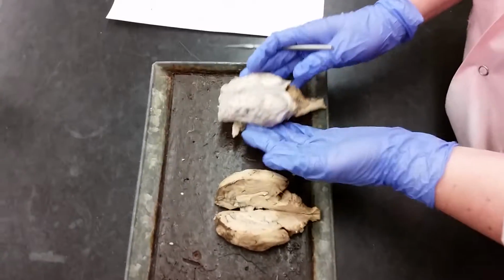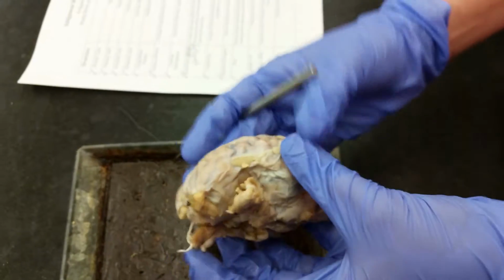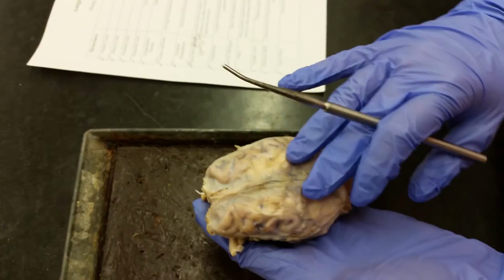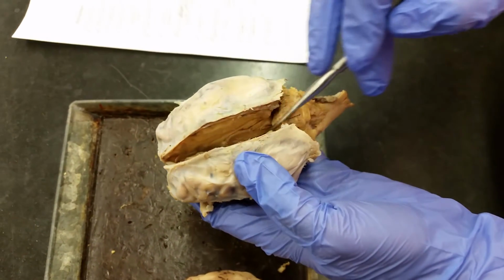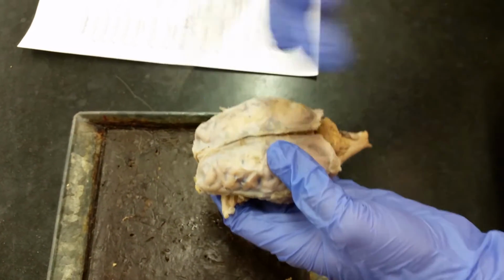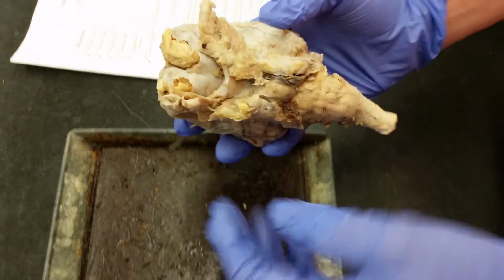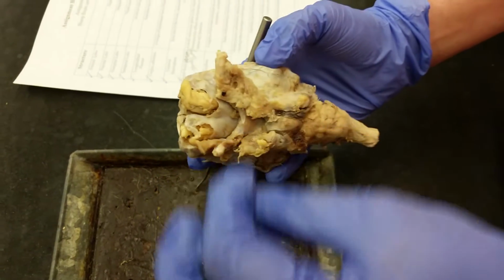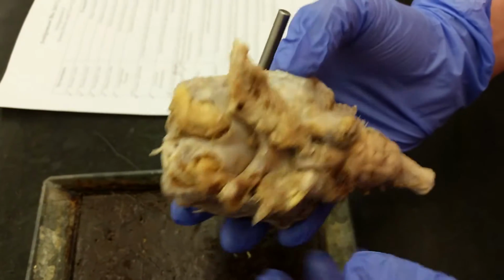Right, so today we're going to be taking a look at the sheep brain. I want to show you, this is what you will get. It's a brain similar to this with the dura mater on top. You can choose to leave that intact and just make a cut down the longitudinal fissure, or we'll take a look at another brain in which the dura mater was almost completely removed. There will be additional tissue that you're going to want to work with, and your TAs and I will help you determine what to keep and what to get rid of.